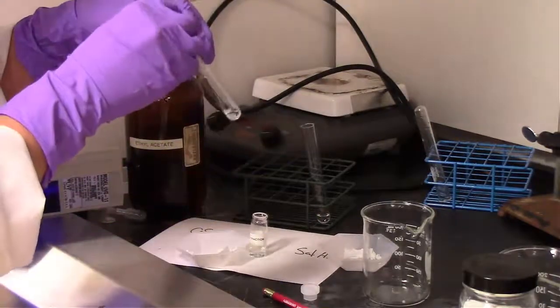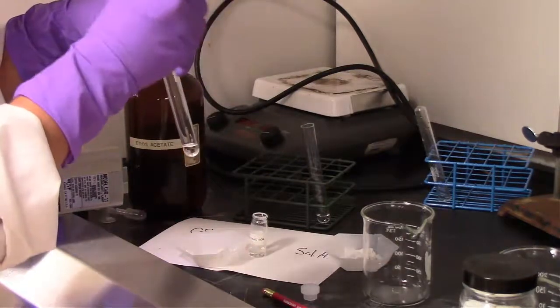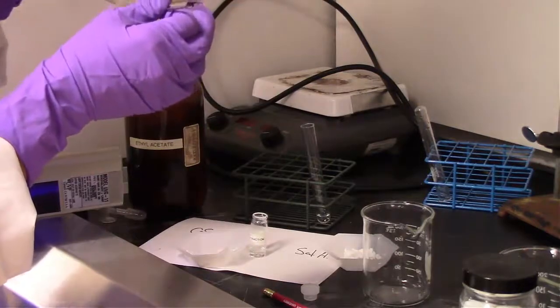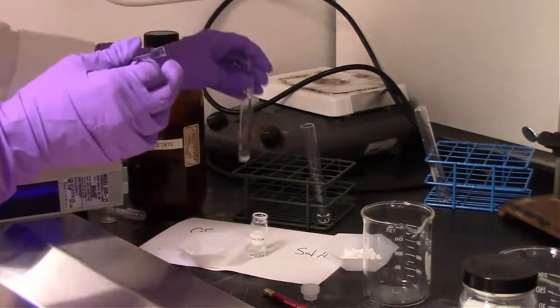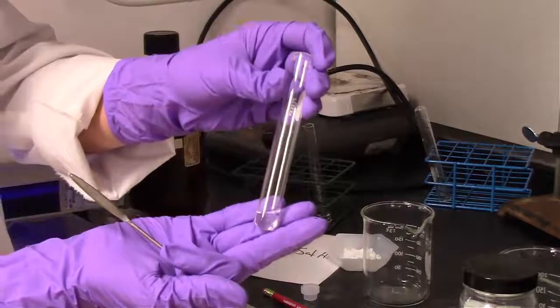Now, what I'm seeing here is that actual UV light in the background, you can see that purple light there, that is on. That's not good. So we definitely want to have that off. It looks like it's actually visible in the camera. And if you look at that UV light, that's going to cause significant damage to the eyes.